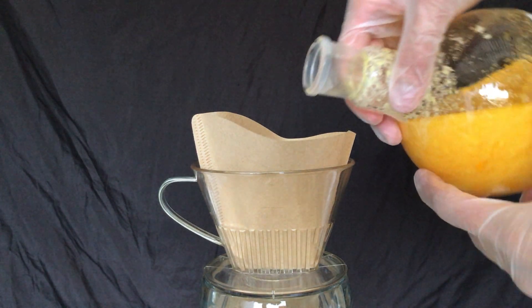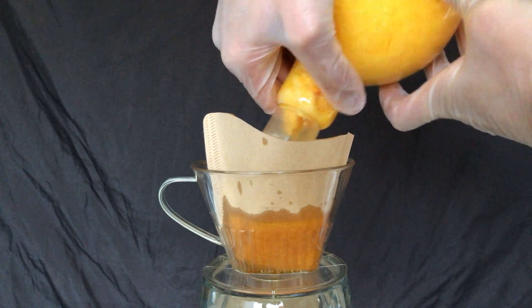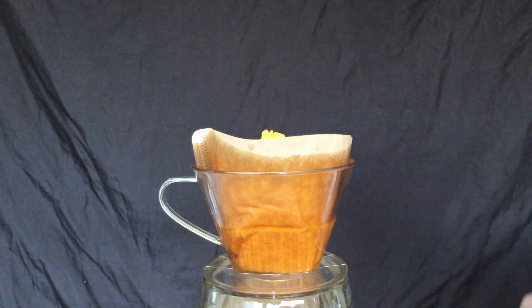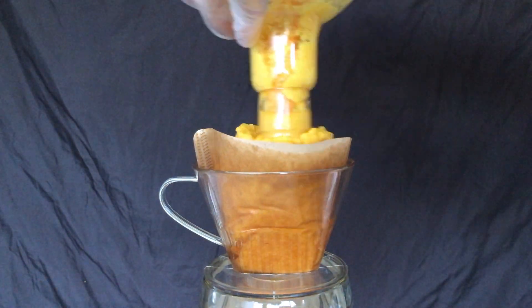I opted to perform a gravity filtration because I didn't want more clean up than necessary and because it was fast enough. During this filtration we get rid of most of the cyanides, but keep in mind that this product will still contain some leftovers and therefore it must be treated as highly toxic.